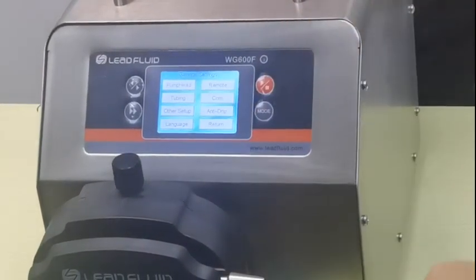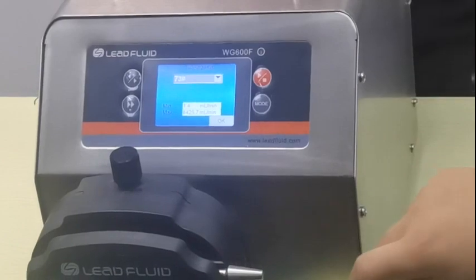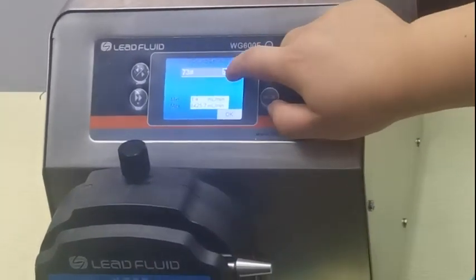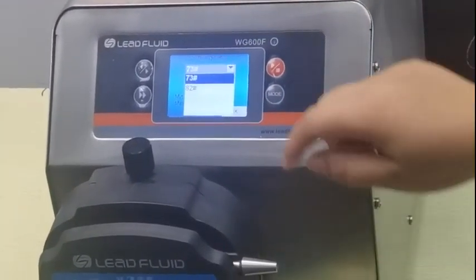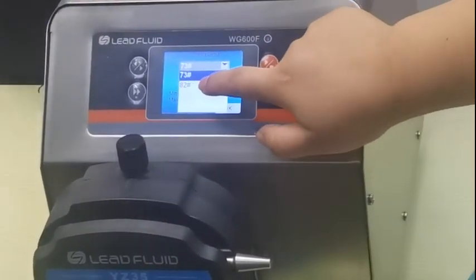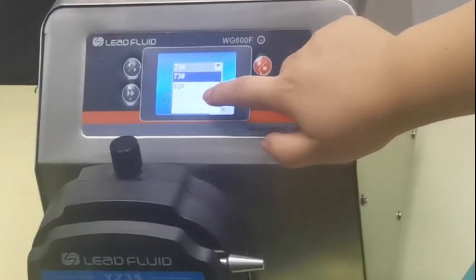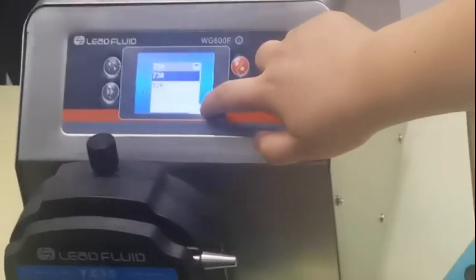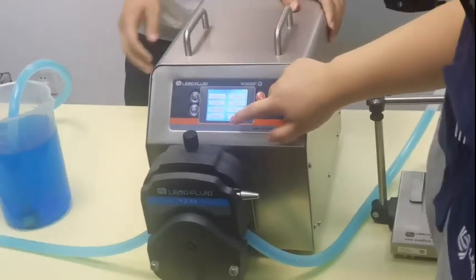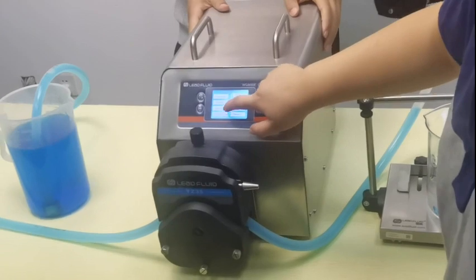Second, you need to know the tubing. There are two choices: 73 and 82. Right now we are using tubing 73.